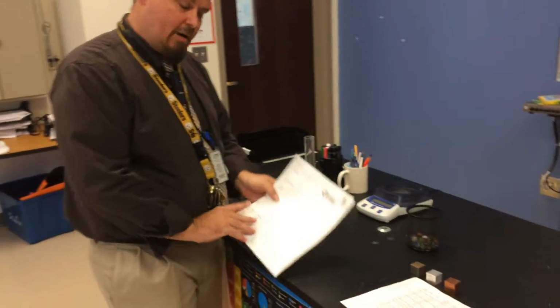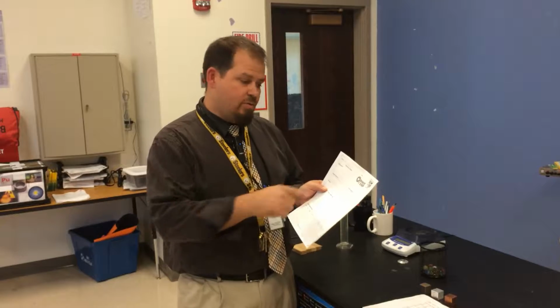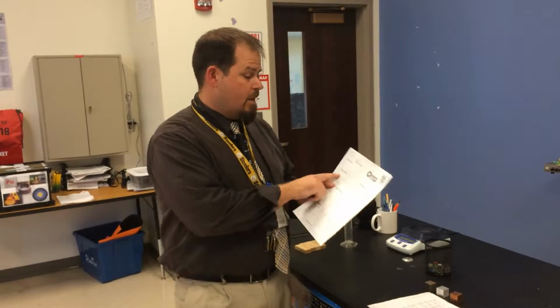All right, so density lab. I got it here, you got it there. Background. Density is an intrinsic value. It doesn't change no matter how big my sample size is, how much I heat it up, or how much I cut it into pieces. It's intrinsic. So we're going to use that. There's your background information. You want to go a little bit more on that? You got an electronic device. Take it a little bit deeper.